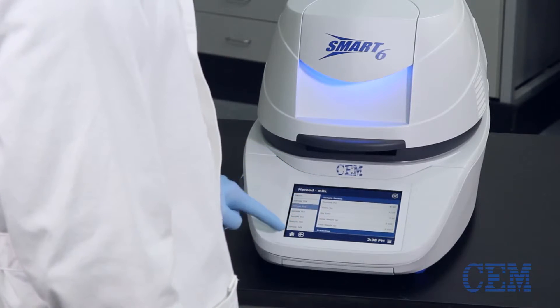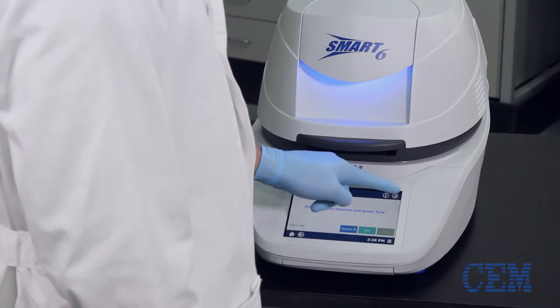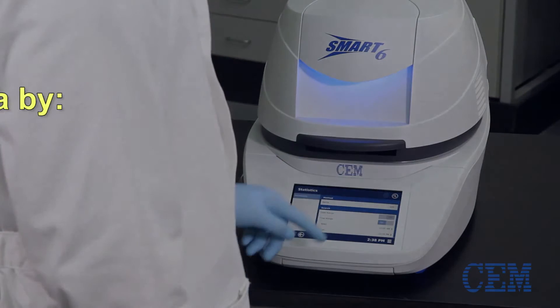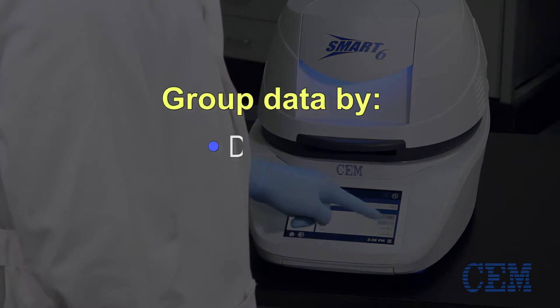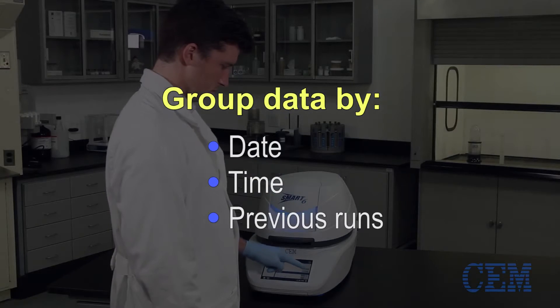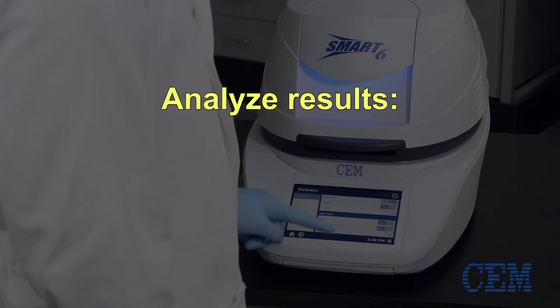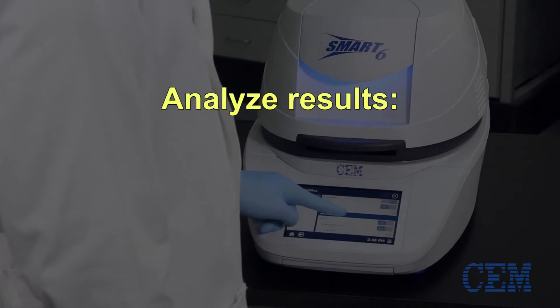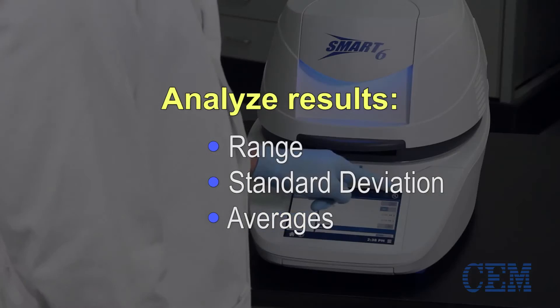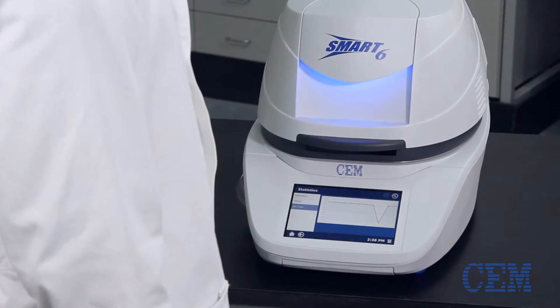If you wish to analyze a group of tests that have been performed under a given method, choose the Graph button in the top right corner. Data can be grouped by date, time, or even the last 10, 20, or any other number of previous runs. Statistical results such as range, standard deviation, and averages can be viewed, and graphs of the results can be displayed.